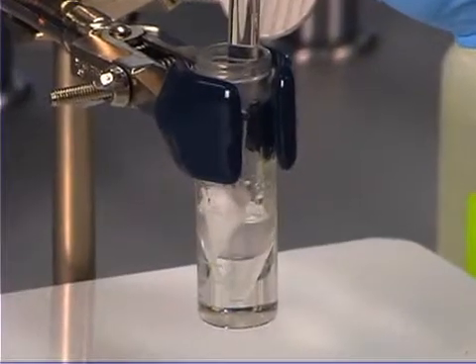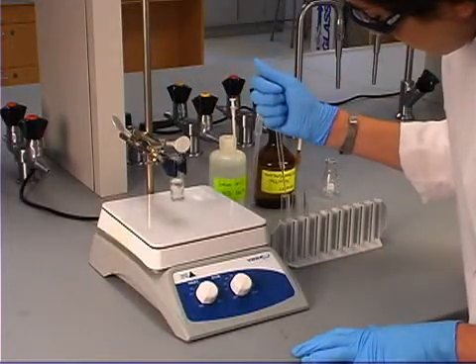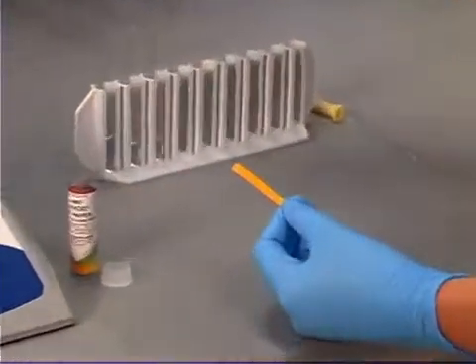Now remove the layer, and continue to wash the organic layer until the last layer you remove is basic. Test the pH of each layer with litmus paper.